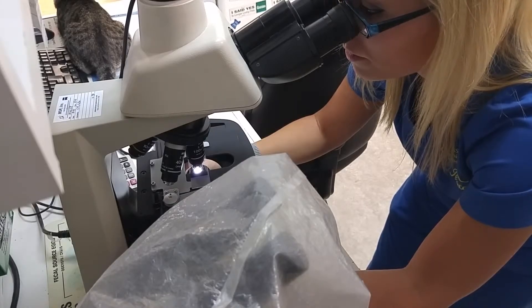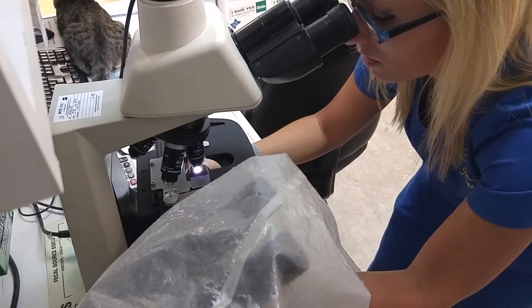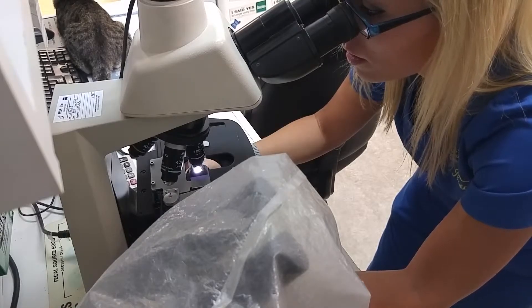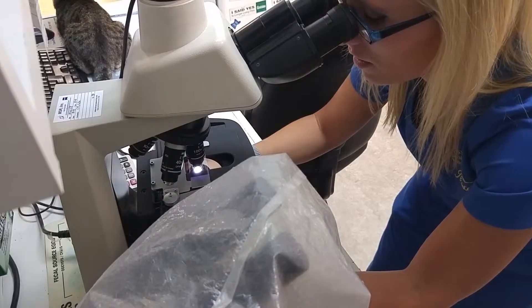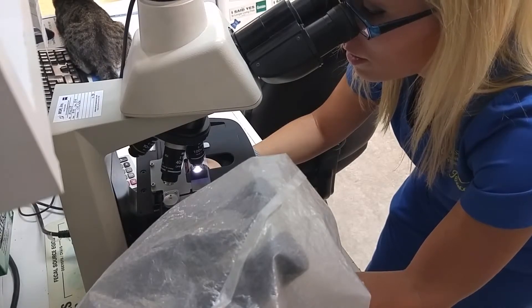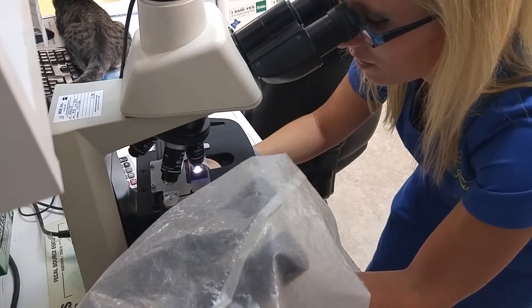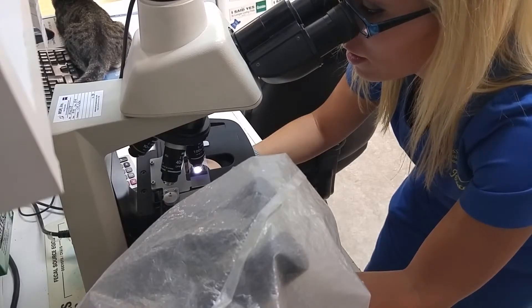Alright, it's nice and dry so we're going to go ahead and take some oil. Just put a drop on there. We'll go to the immersion oil, the 100x. Focus just to make sure that we can get as close as we can.